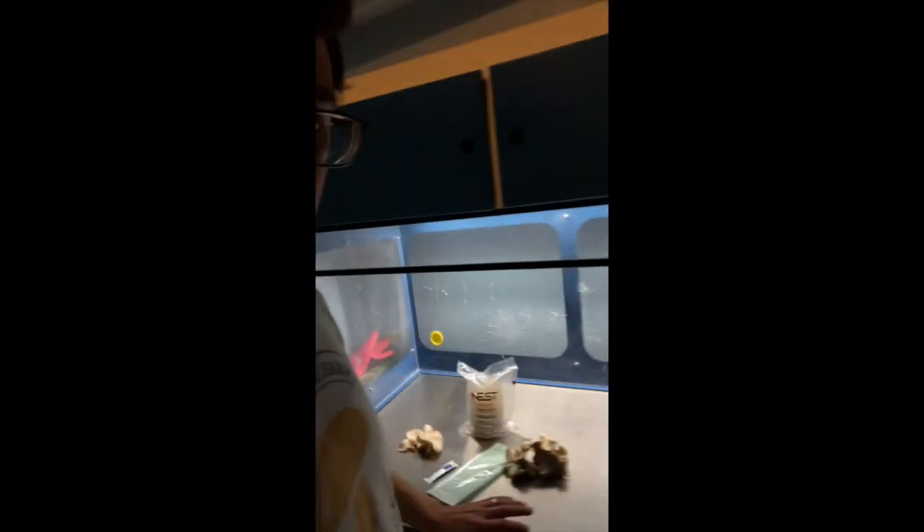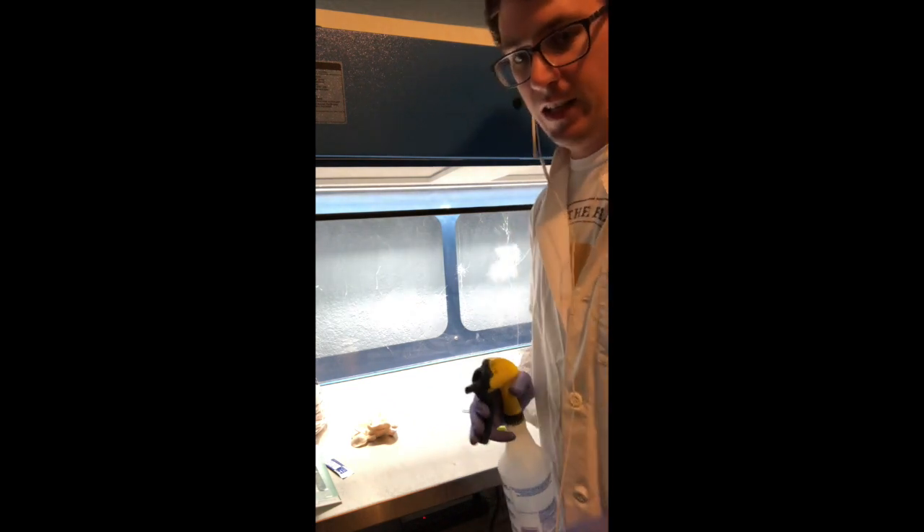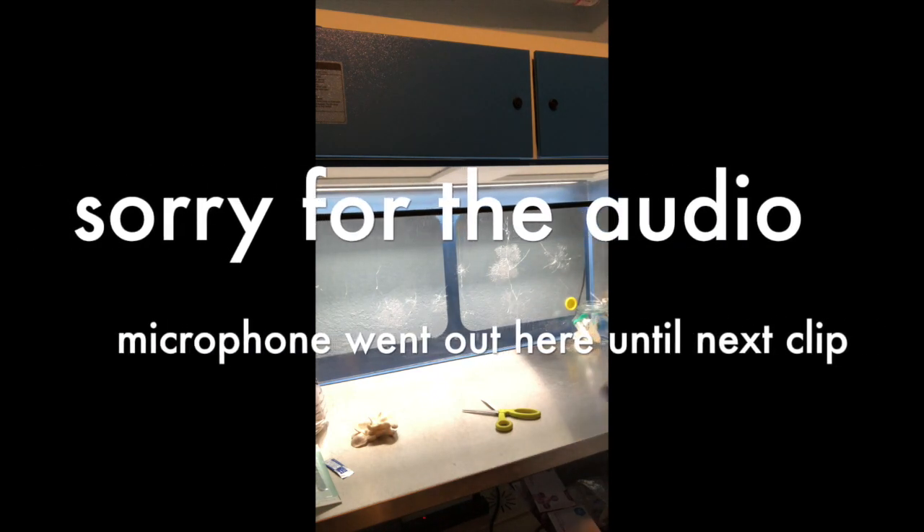The first thing you want to do is clean out the hood, which I've already done. It doesn't have to be super clean if you're cloning mushrooms like these that came from the fruiting room, so it wasn't 100% sterile. But it's always good to clean your hood with bleach and get everything ready. I'm going to spray it one more time with alcohol for one last clean.